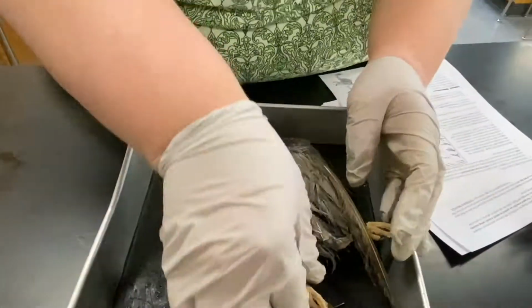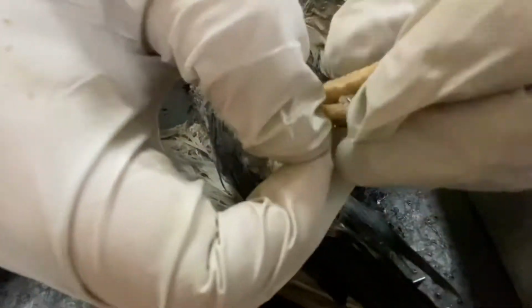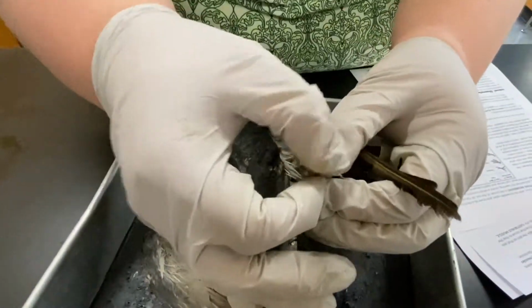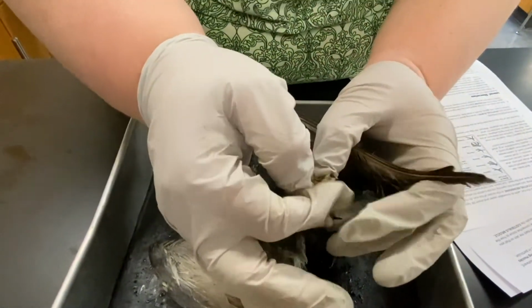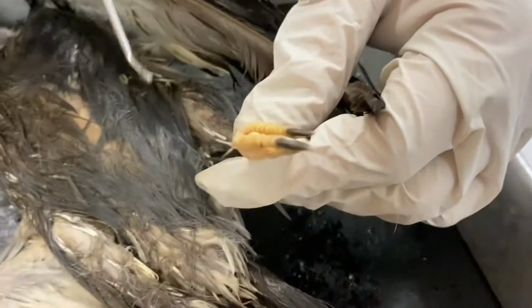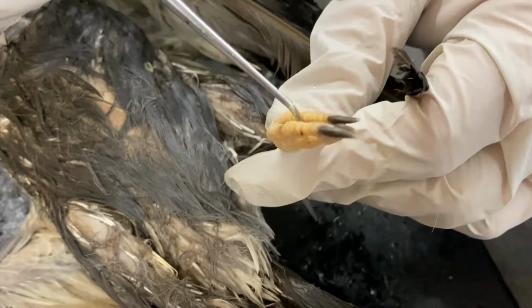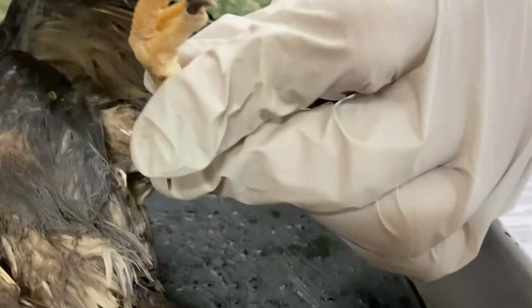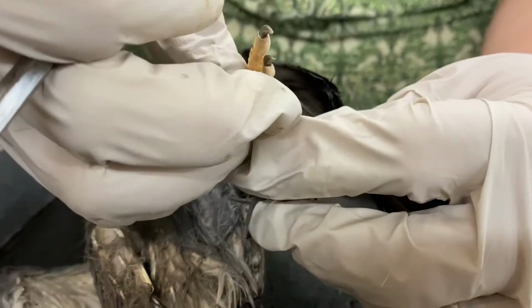I showed you already, but let's take another look. A real good look at the shape of the foot. You can tell by the handout, again, because of the way it was preserved and then packaged, they're a little bit hard to see the shape, but you can tell given the shape, this one normally would orientate itself back with 3 forward.